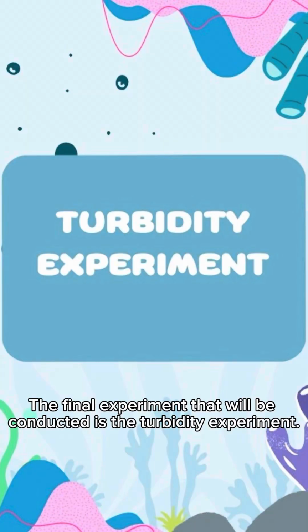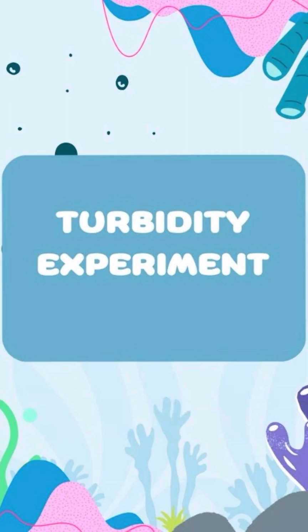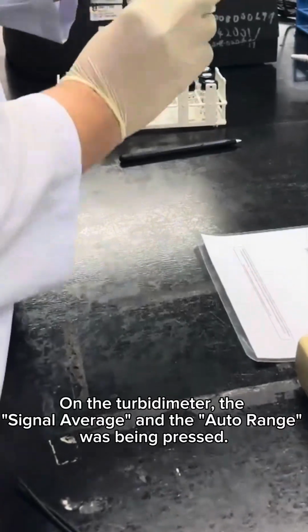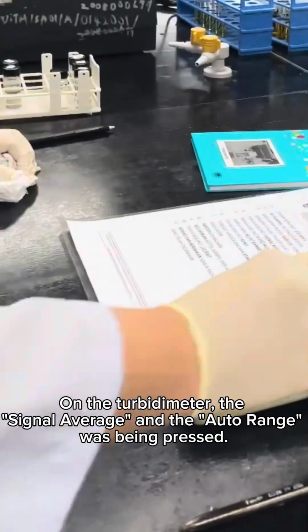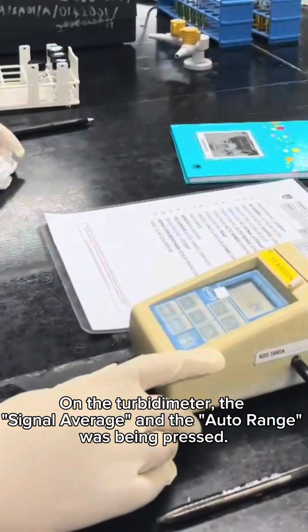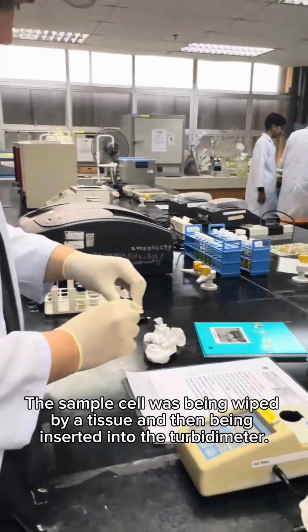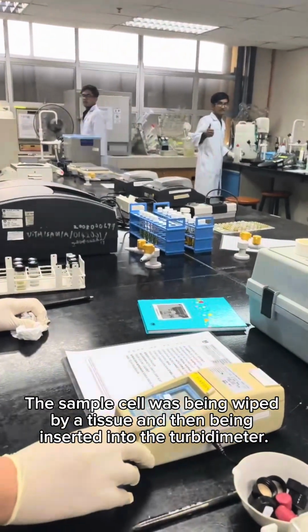The final experiment that will be conducted is the turbidity experiment. From this particular experiment, the value of turbidity of the wastewater will be obtained. The turbidimeter was turned on. On the turbidimeter, the signal average and the auto range were pressed. The sample cell was wiped with a tissue and then inserted into the turbidimeter.